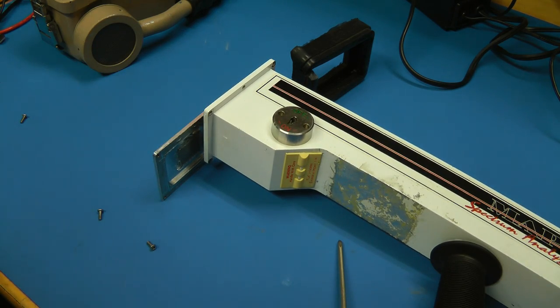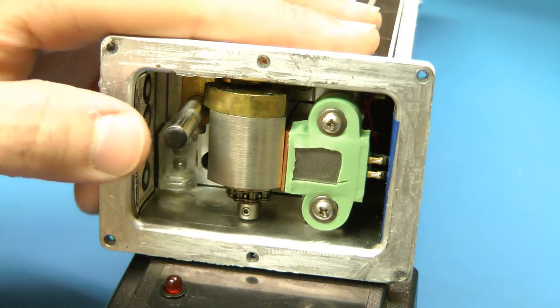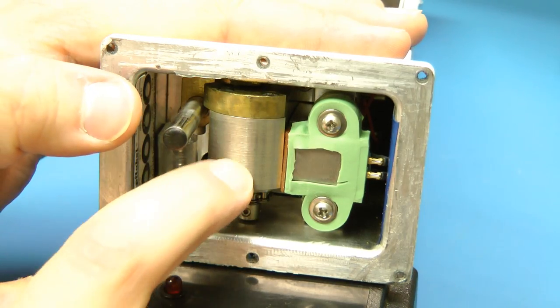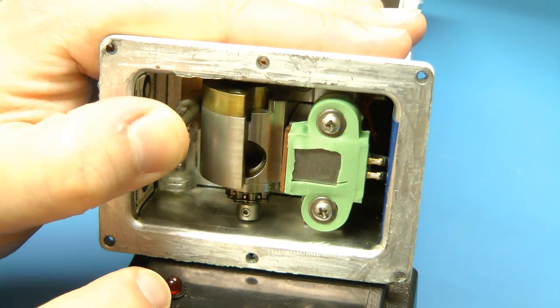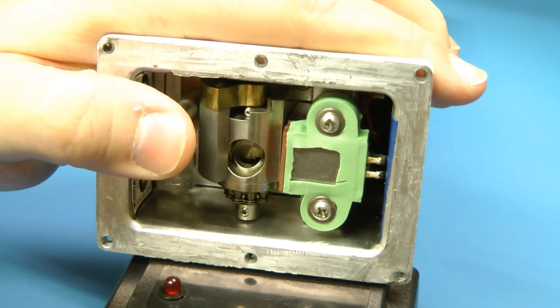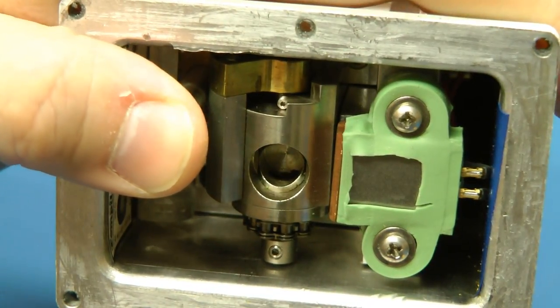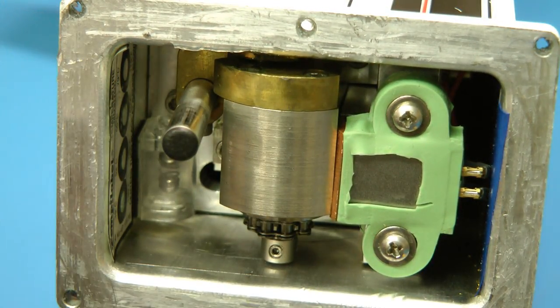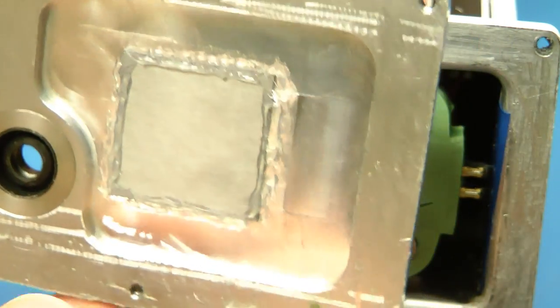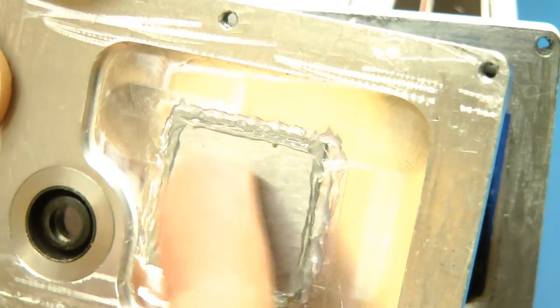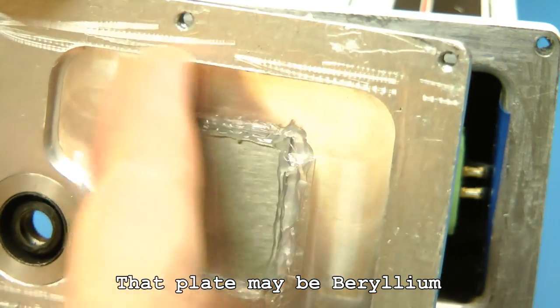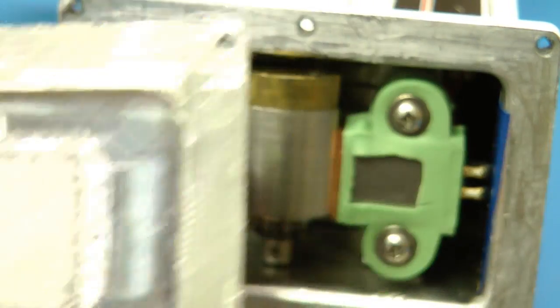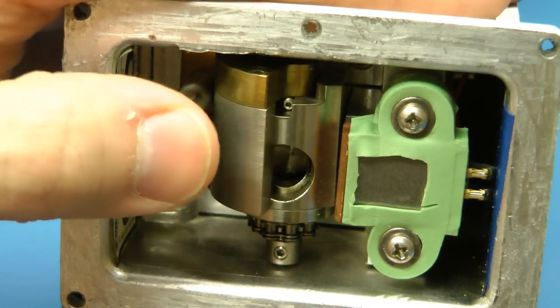So this seems to be safe. So here's a much better view of how this works. Yeah, this just pushes this large steel or lead shield out from in front of the source. And there's definitely, there is no source remaining in there. So someone has been in here and has removed it. This was all sealed with silicone.